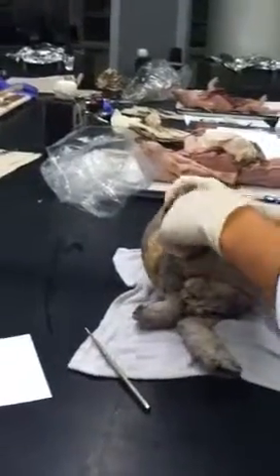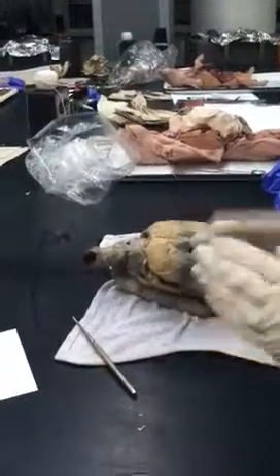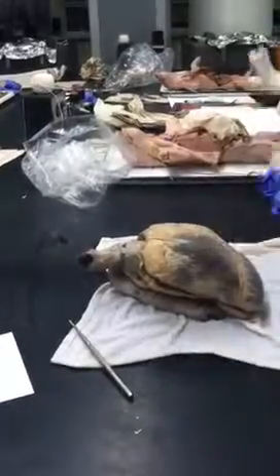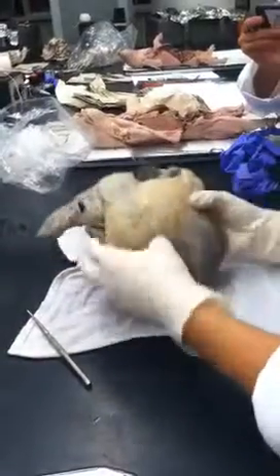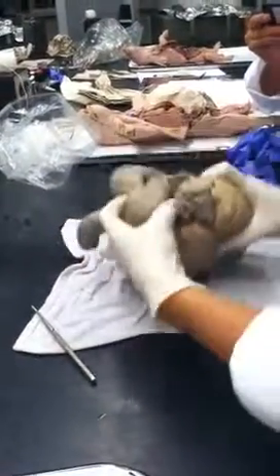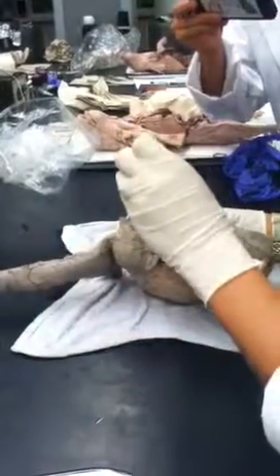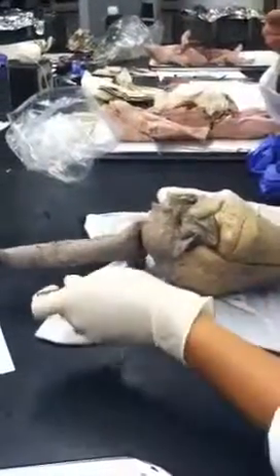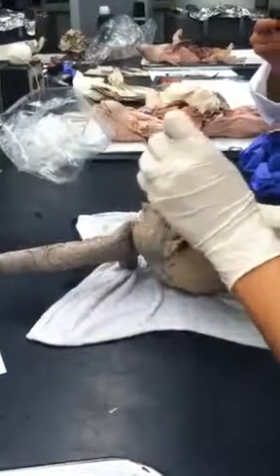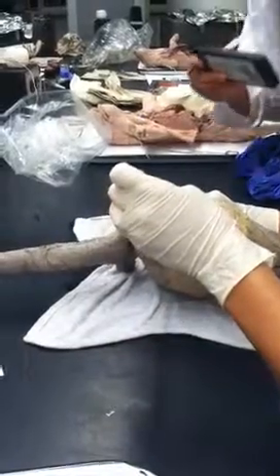See that? So when the right ventricle pumps, it goes up through something called the semilunar valve, which is actually really hard to show on here, but I'll show you the semilunar valve on the other side. So let's just imagine that happens. Right ventricle pumps, blood goes up through the semilunar valve into the pulmonary trunk, right? And then over here we have two pulmonary arteries. This is pulmonary artery number 1, pulmonary artery number 2. So it goes through the pulmonary trunk until they split off into the pulmonary arteries. If I put a pin here, you'd say pulmonary artery, but if I put a pin here, you'd say pulmonary trunk. Does that make sense?